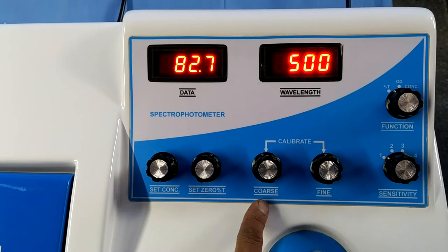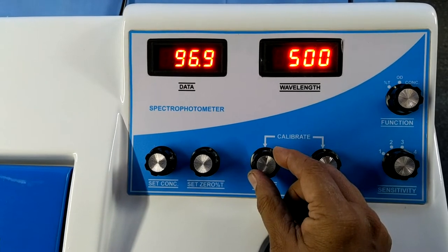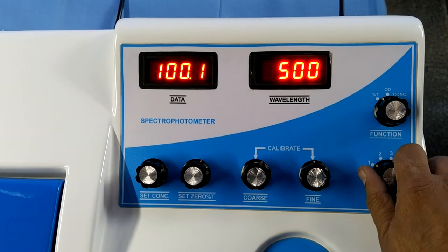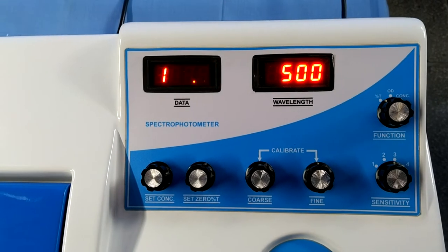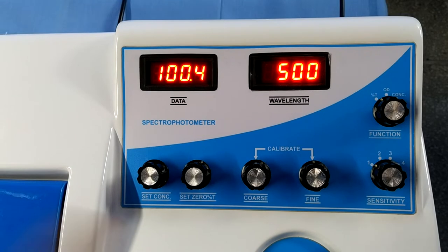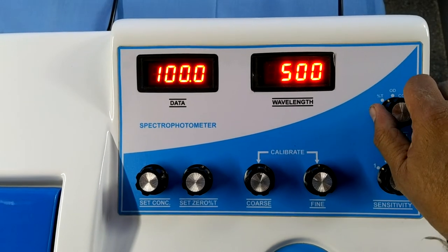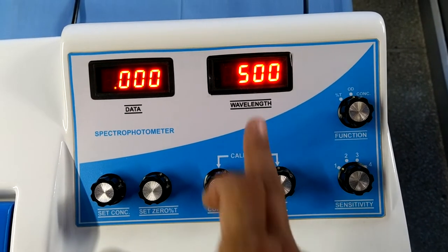Set 100% transmission from the coarse and fine knobs. If you don't achieve 100% from coarse on sensitivity 1, then go to sensitivity 2. If you don't achieve on sensitivity 2, then go to sensitivity 3. Always use minimum sensitivity. I am using sensitivity 1. This is 100% transmission. Now go to OD — optical density absorbance — it shows 0.00. Now it is calibrated on 500nm.